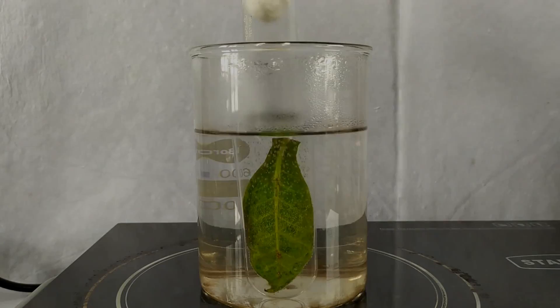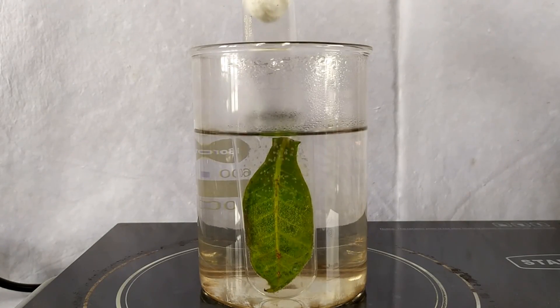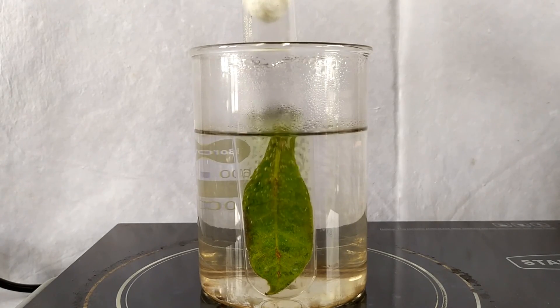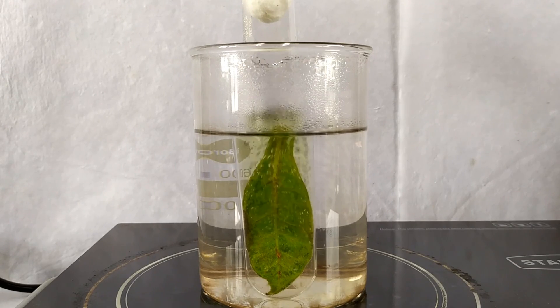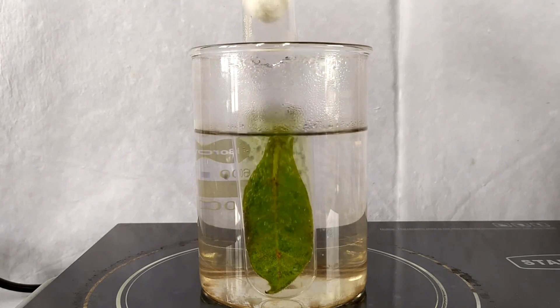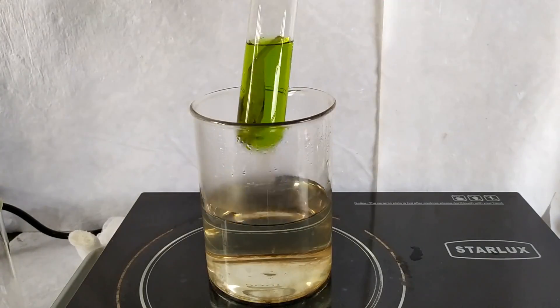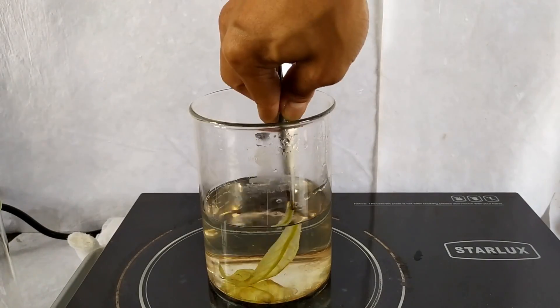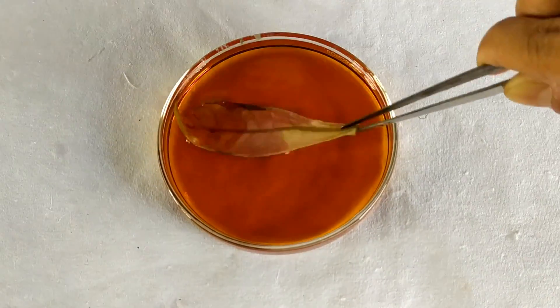During this boiling step, chlorophyll pigments in the leaf are decolorized by the hot alcohol solution, resulting in a bleached leaf with pale white color. This step is necessary for better visualization of the iodine-starch reaction on the leaf surface in the later part of this experiment. Once bleaching of the leaf has been accomplished, remove the leaf from the alcohol using a forcep. Briefly place the leaf for a few seconds in the hot water bath in order to soften the leaf.